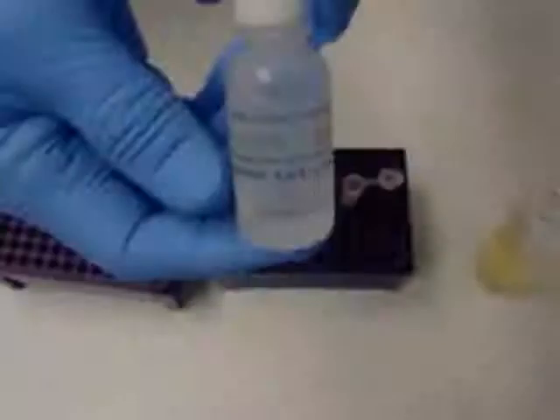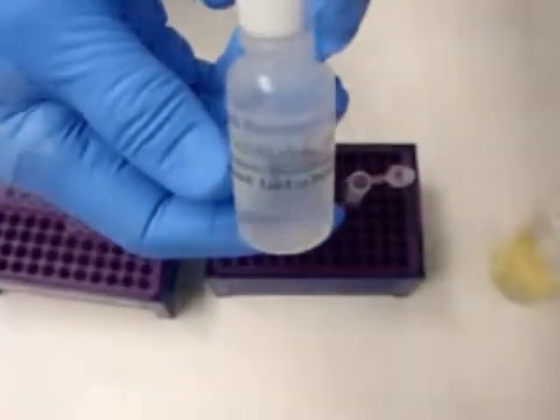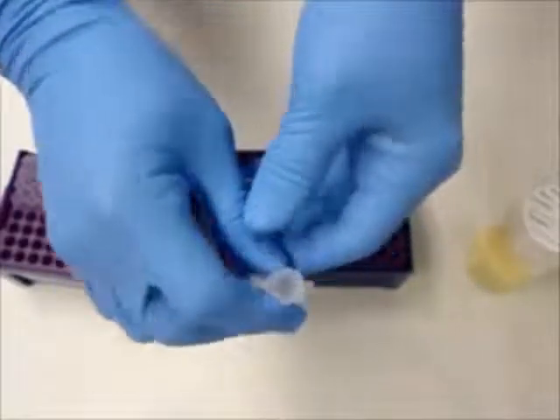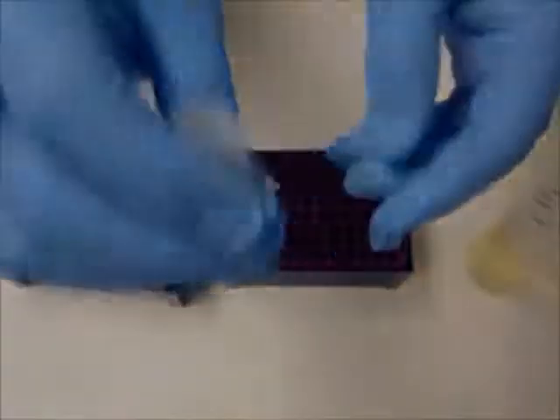Wait 10 minutes. During this time, the reagent C is lysing the bacterial cells open and releasing the bacterial enzymes, which will be detected by the Enzotec fluorescent assay. After 10 minutes, add 2 drops of reagent A to each plastic mixing vial. Secure the cap and gently shake to mix the solutions.